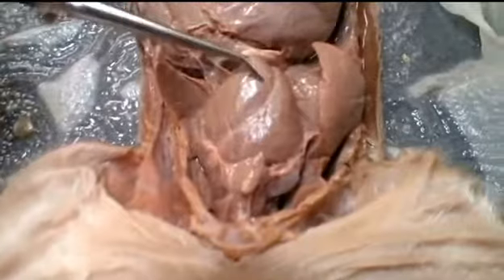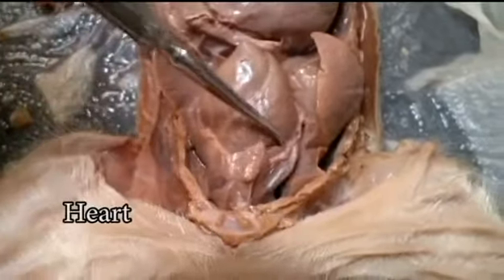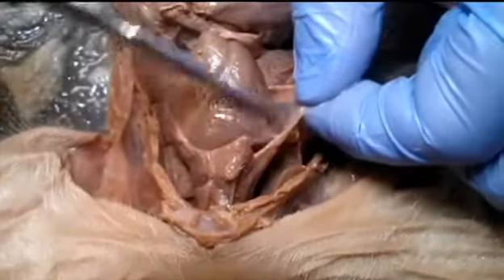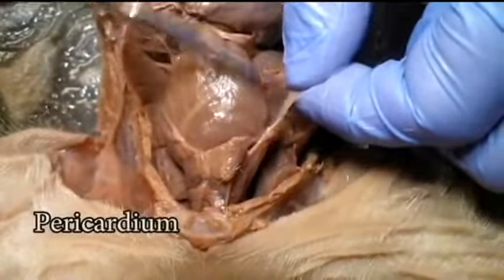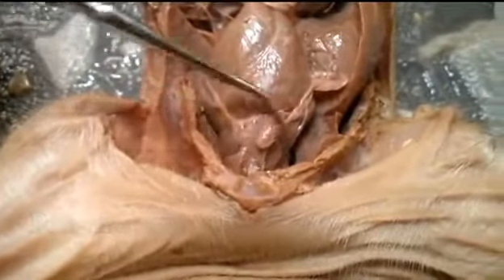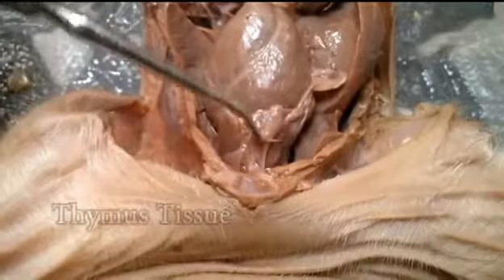This is the heart. This clear tissue around the heart is the pericardium. And right over here, sitting on top of the heart — superior to the heart — is the thymus tissue.